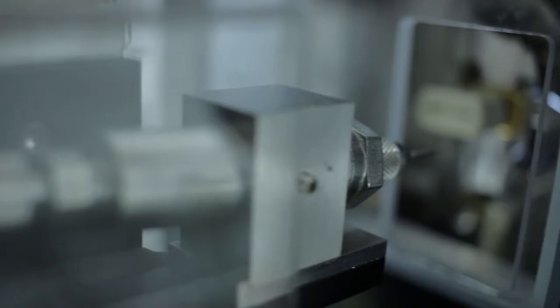The instrument has a nano-electrospray ionization source, which allows us to use very low amounts of sample. Once you ionize the sample, the ions travel to a quadrupole and afterwards to an ion mobility cell.